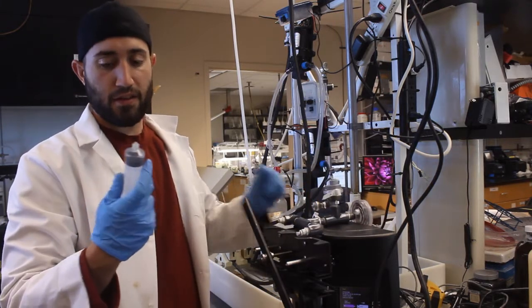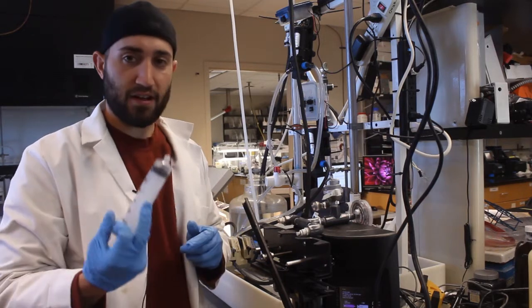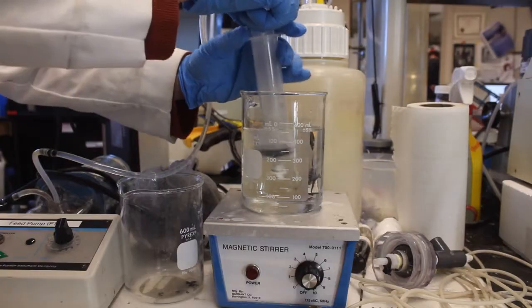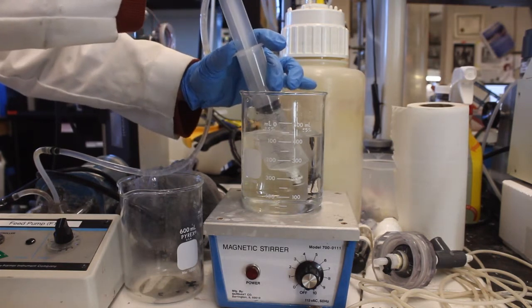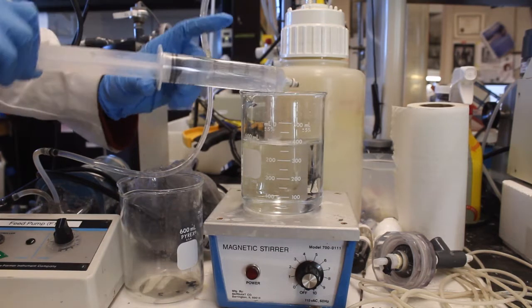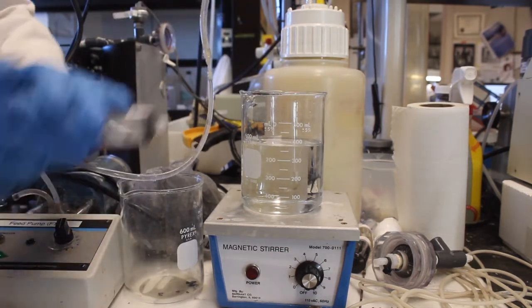Now take and either replace these with new syringes or clean the existing ones if it is not too fouled already. So gently place your syringes into the beaker and withdraw the entire contents up. And we are going to do this for both syringes.